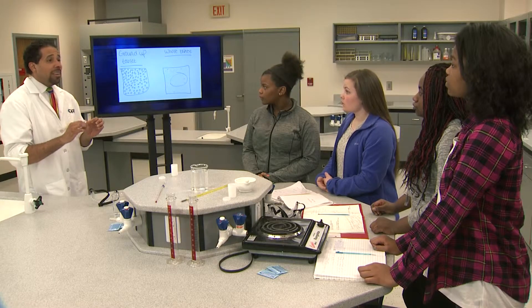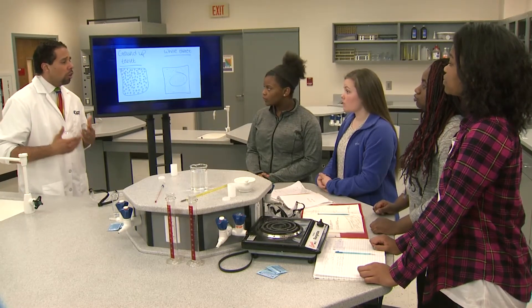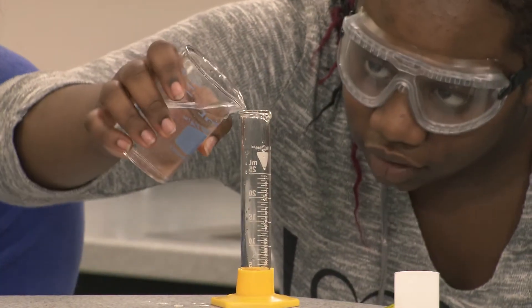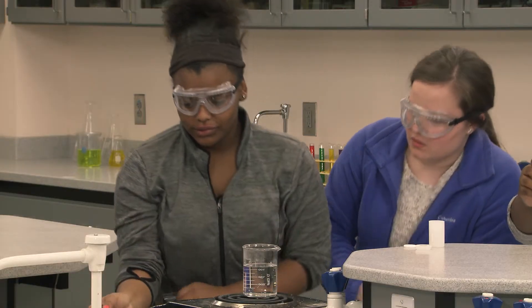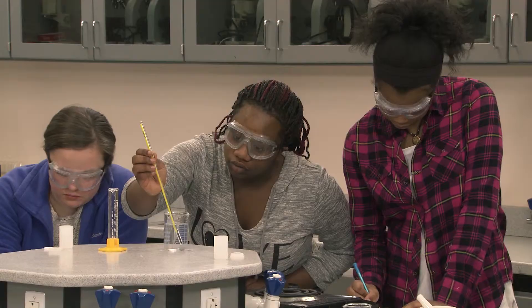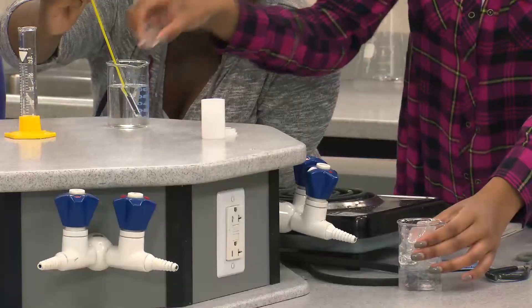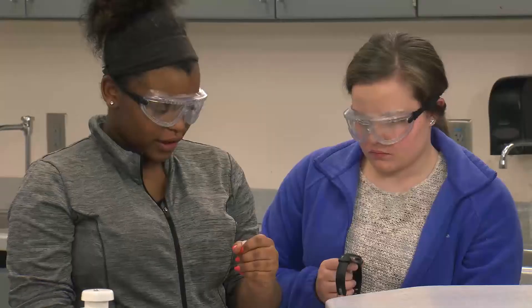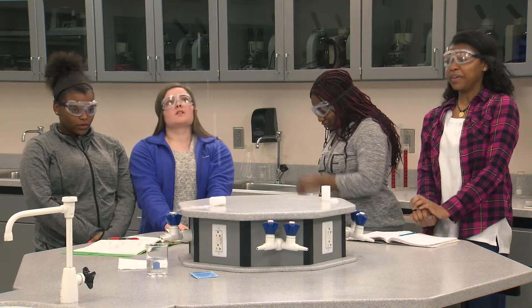Excellent planning by both groups. I think we're ready to gather our supplies and begin the experiment — make sure you record and analyze your data. We'll compare results and conclusions when everyone's done. I'll grind the Alka-Seltzer, and I'll get the water ready. It's about 80 degrees — that's warm enough. I think we need more ice. I think we're ready to put the tablet in — put the lid on quickly.